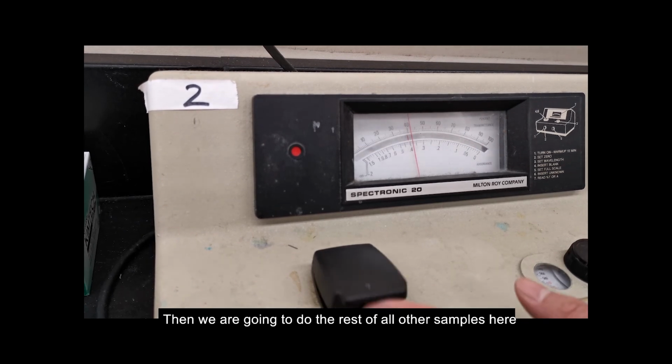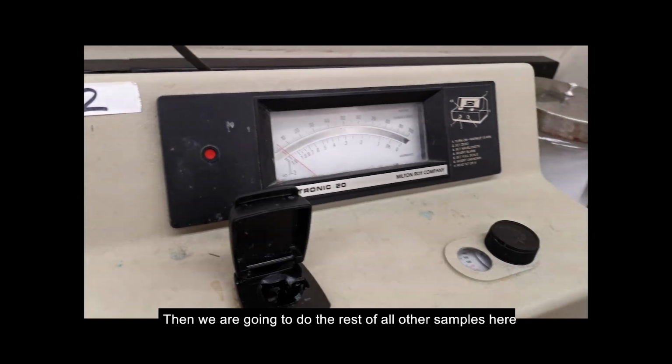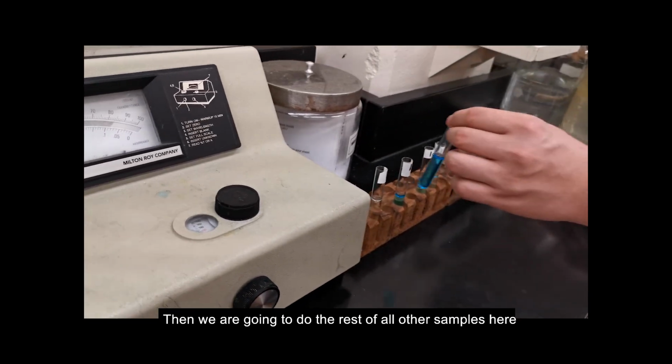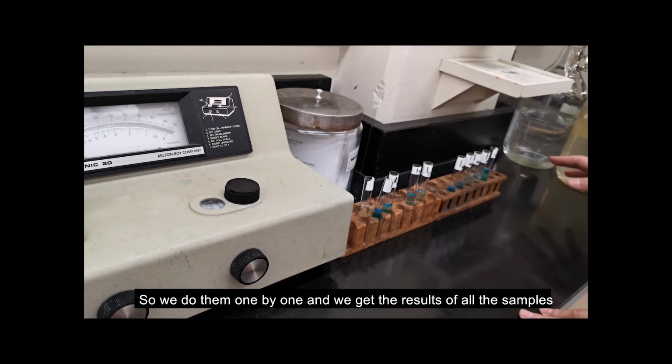Okay. Then we are going to do all the other samples here. We do them one by one, and we get the result of all these samples.